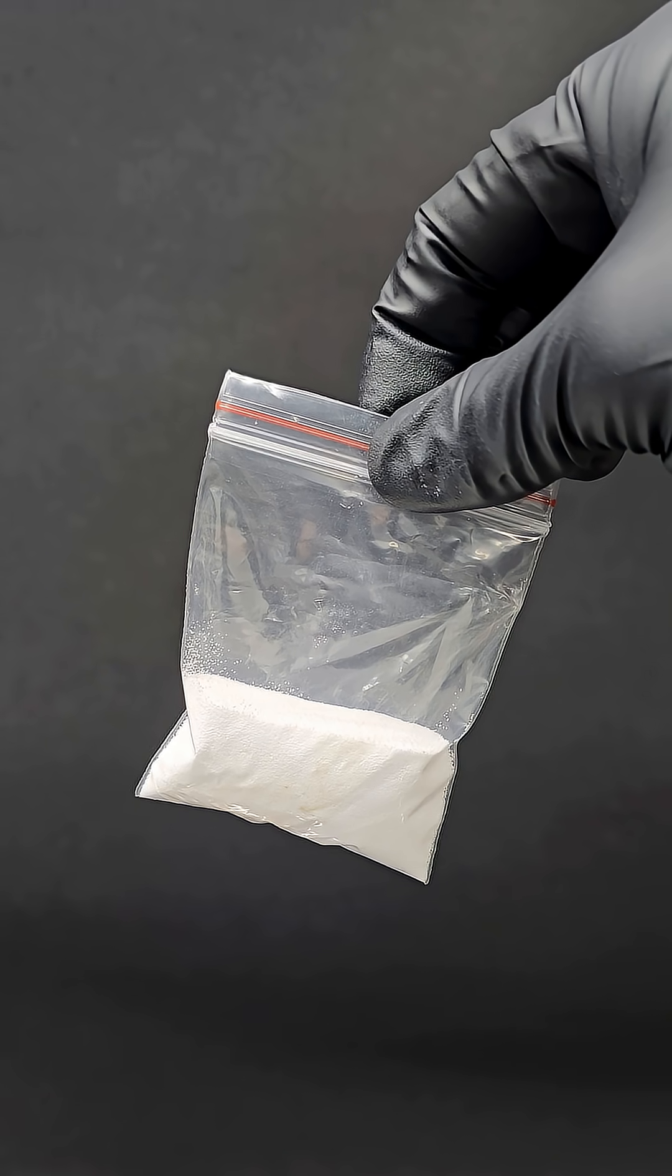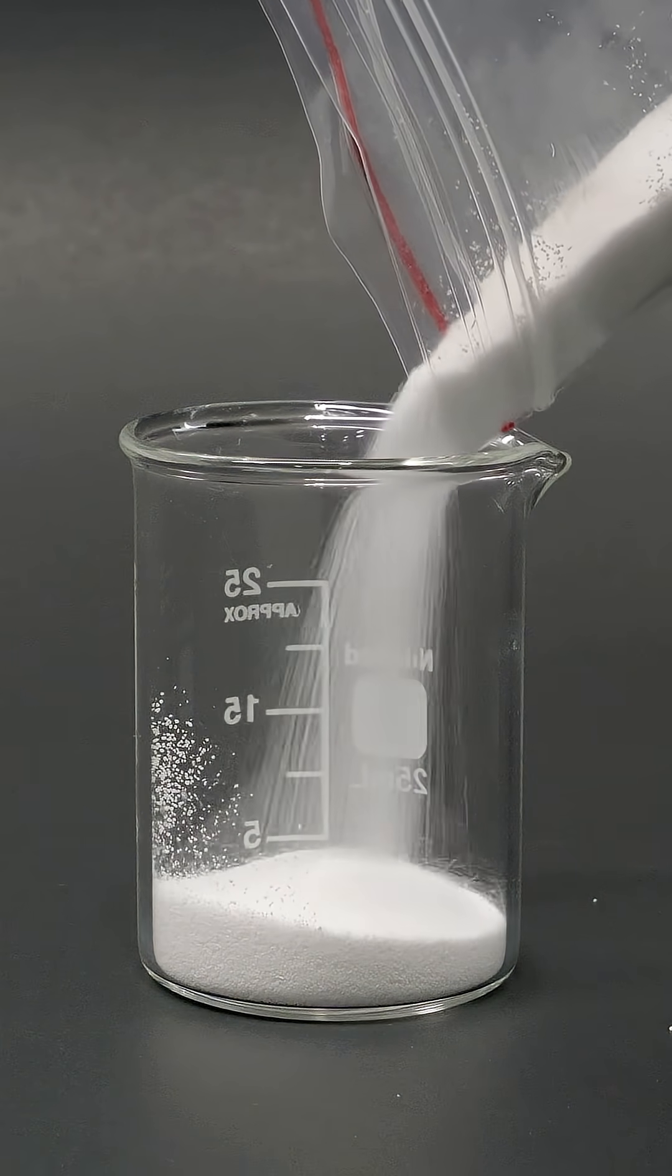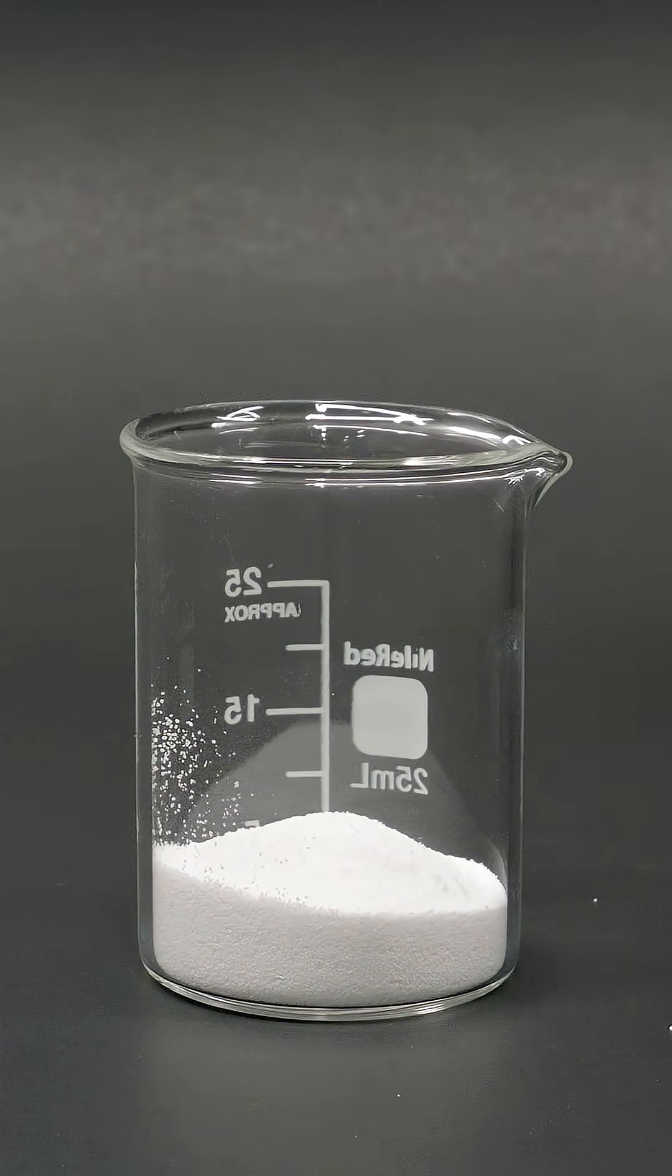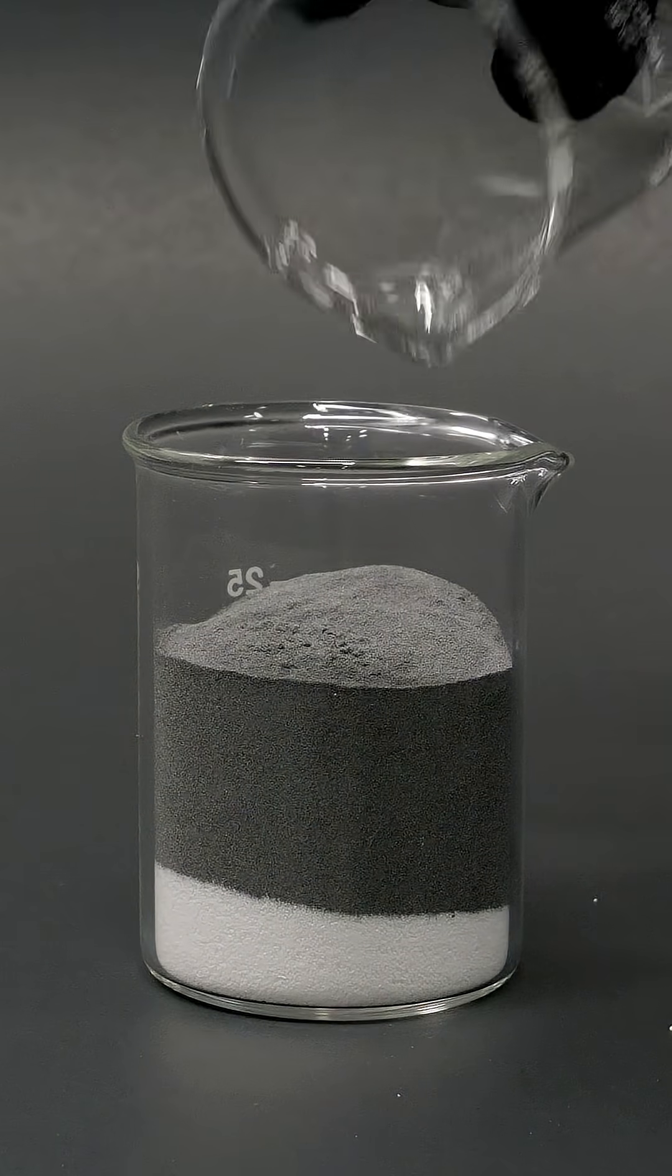It's also relatively easy to do this. I'll just get started by quickly adding some of it into a small beaker and then on top of this I'll dump in the only other ingredient that I'll need, which is some powdered magnesium metal.